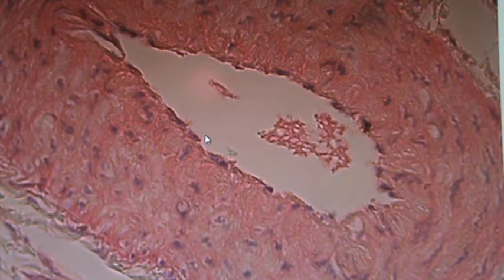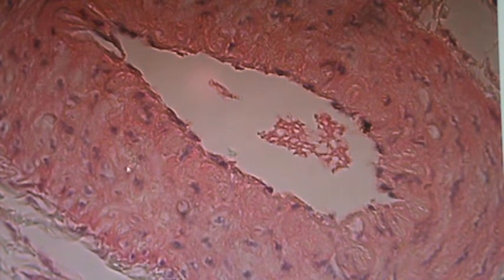The next layer after that, as you move on through here, is out here, and this is major tissue type muscle, and the specific type is smooth. All arteries are going to have a very nice big layer of smooth muscle. The veins have less, and we'll see some of that in a moment. Then further out along the edge as we come down this way would be areolar connective tissue, and it basically just takes up space. We'll see some more of that in a little bit, but that's connective tissue, and we call that areolar. Okay.